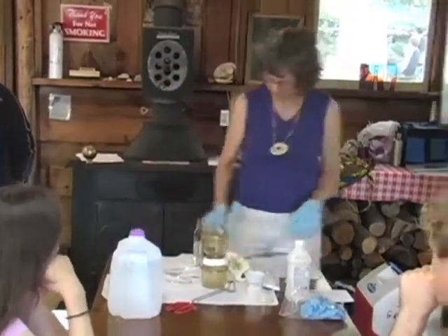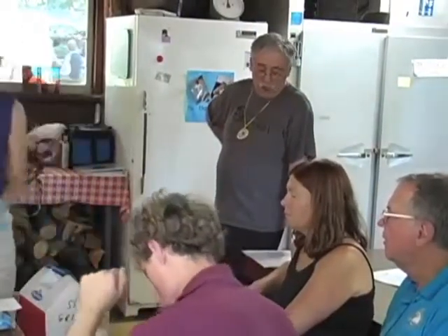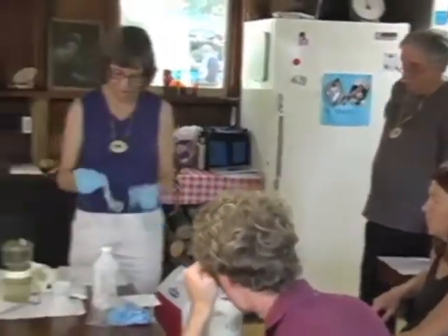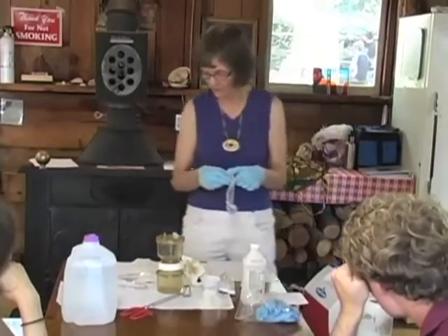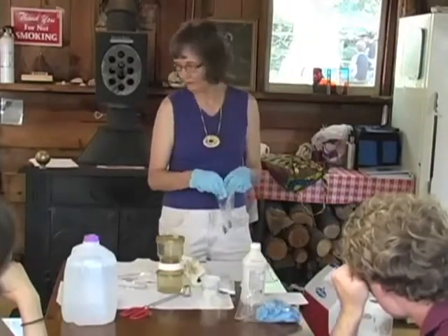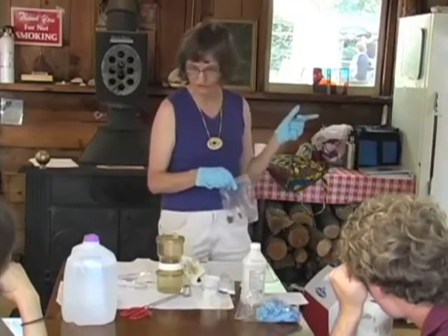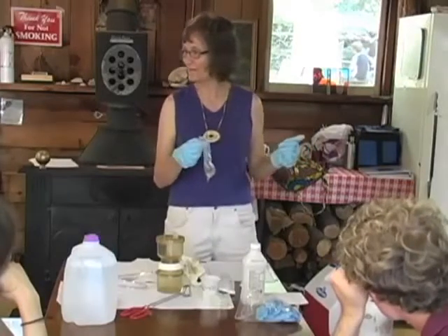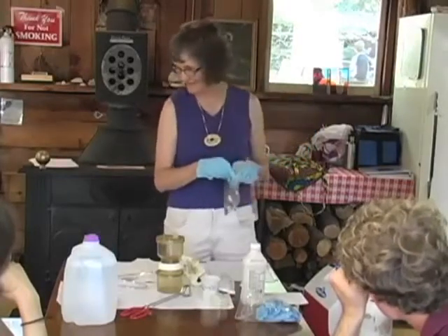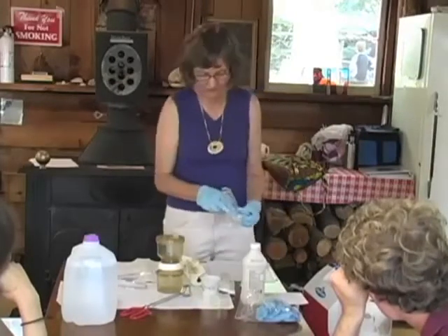Go ahead, David. Step 2: Add nutrient broth from 1 plastic ampule to a petri dish and put the top back on and set aside. Now the nutrient broth is supposed to stay chilled, as well as the sample water. This test may or may not come out correct because the sample water we put in the fridge yesterday, and the refrigerator started getting full. And so the sample water got put out on top last night, so it didn't stay chilled. So that will obviously alter our results.